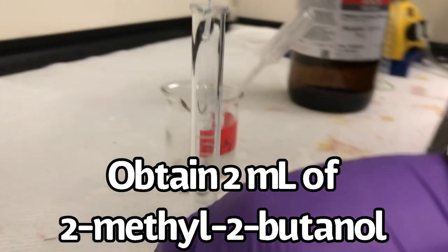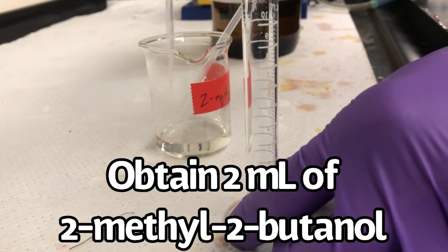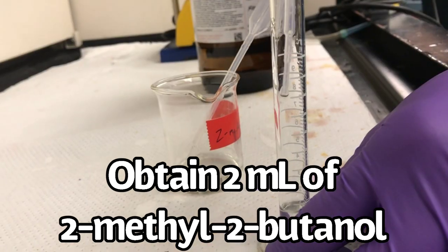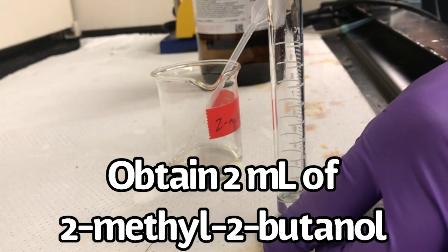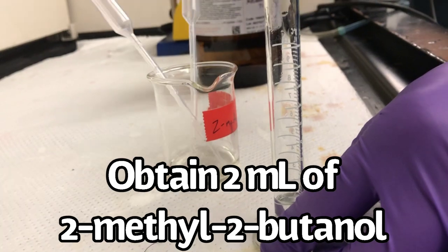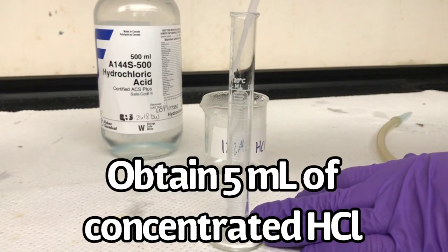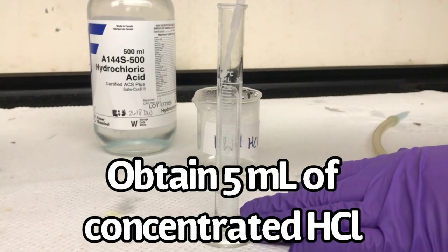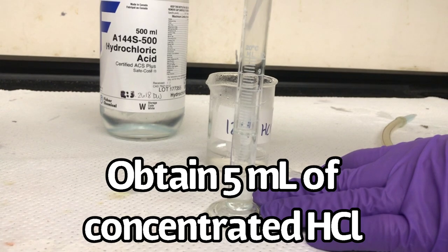Start by obtaining 2 milliliters of 2-methyl-2-butanol. Next, obtain 5 milliliters of concentrated hydrochloric acid.